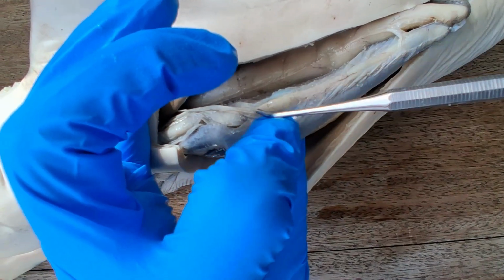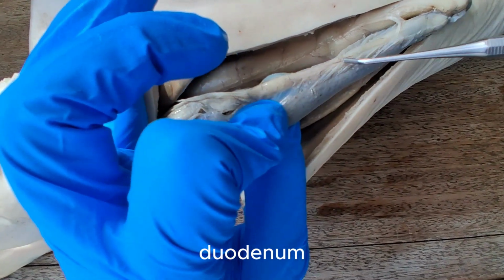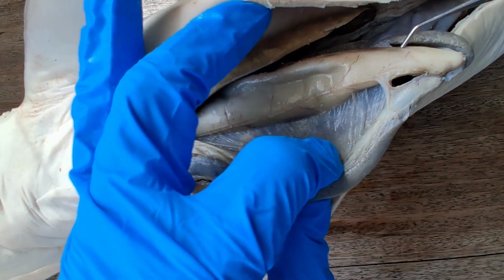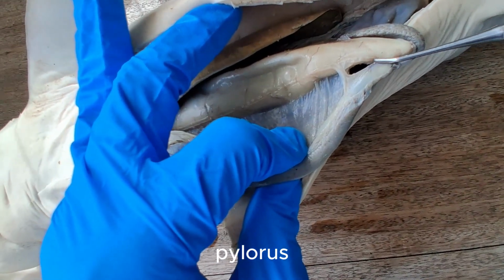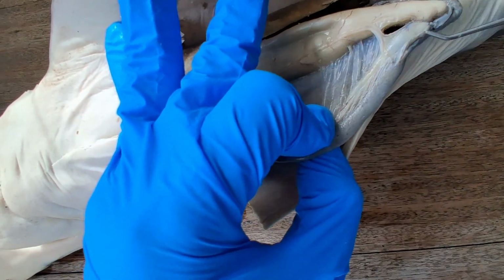So as always, the first segment of the small intestine is the duodenum. It's a duodenum. This is the pyloric end of the stomach. As with the rabbit, there's a smooth muscle sphincter there, regulating the passage of chyme from the stomach to the small intestine. It's the pyloric sphincter.